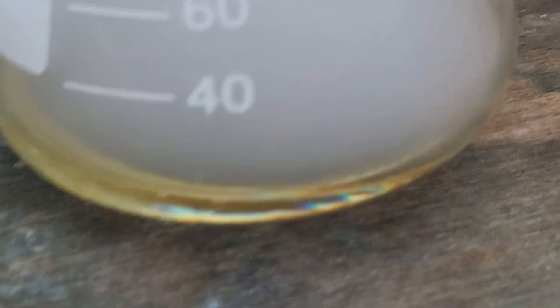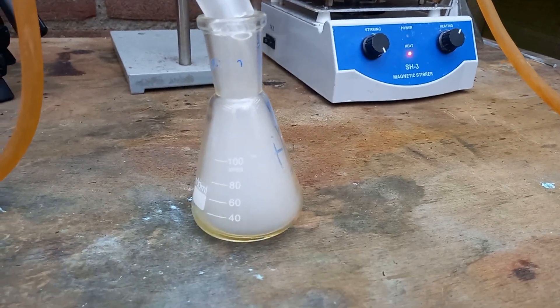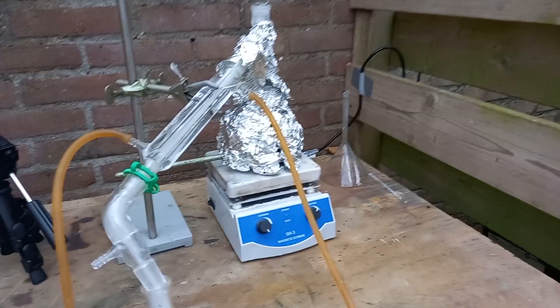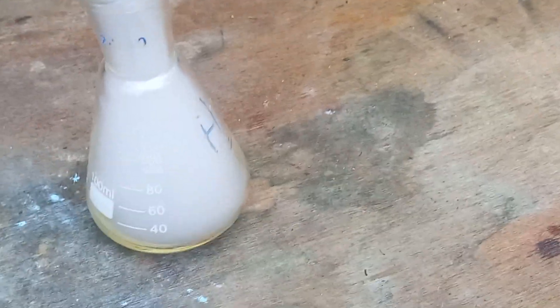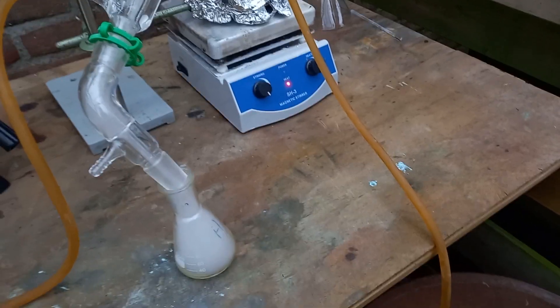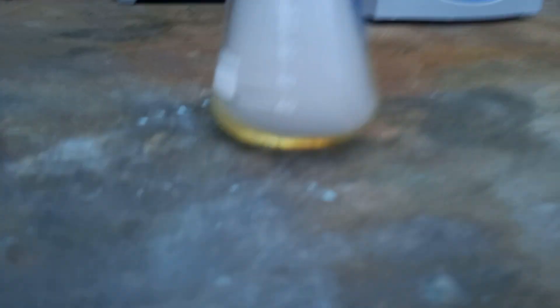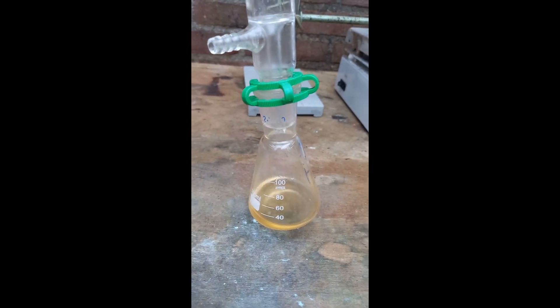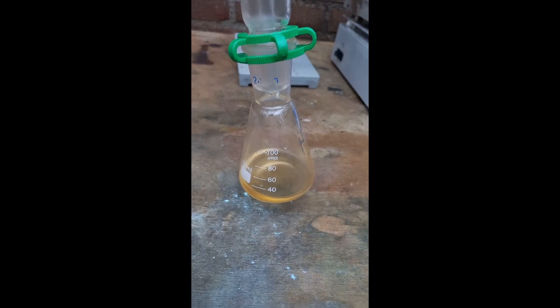As you can see, there's already quite a lot of pyridine coming over, but also a lot of white — probably niacin smoke — so that's not good. I don't have a heating mantle, so I cranked the heat all the way up to get it hot enough. And now it's too hot, of course. But still, there's distillate, so it's the perfect temperature, I guess.